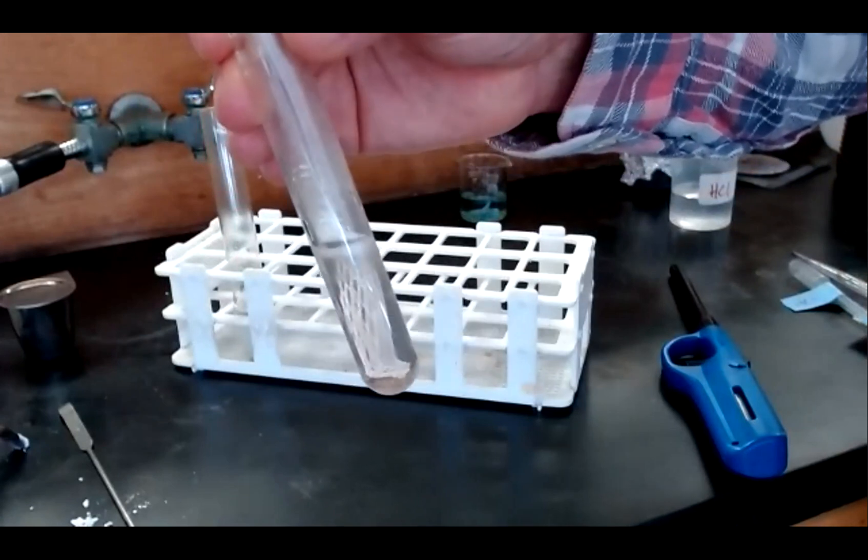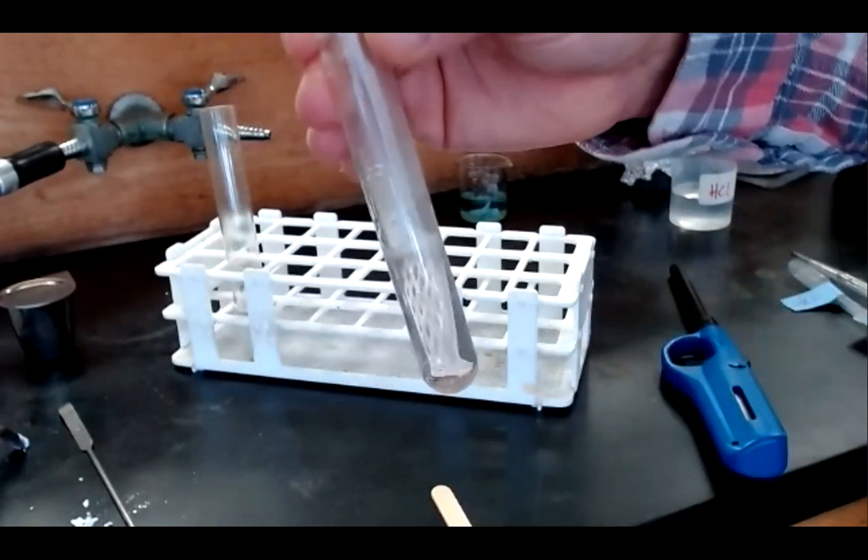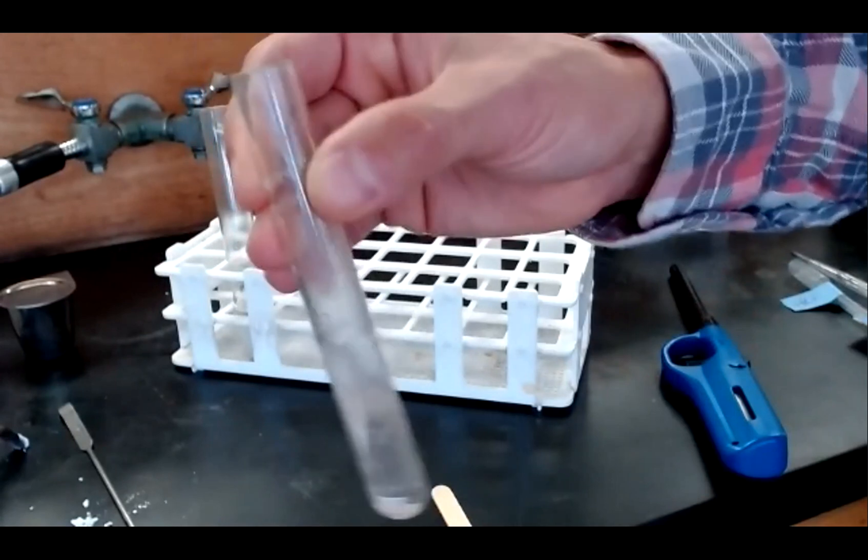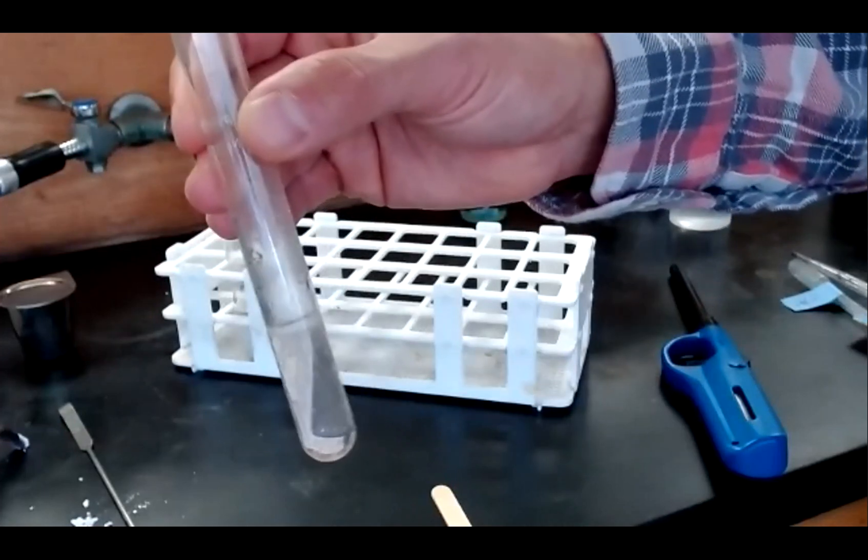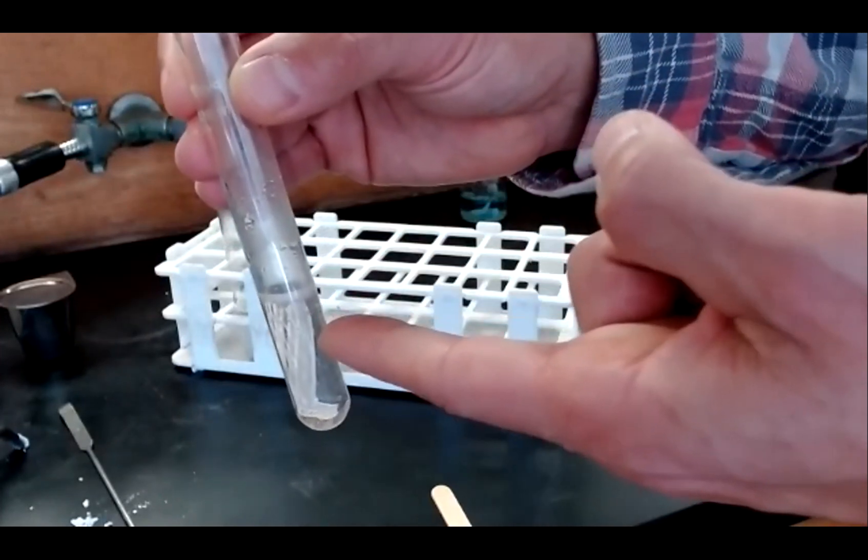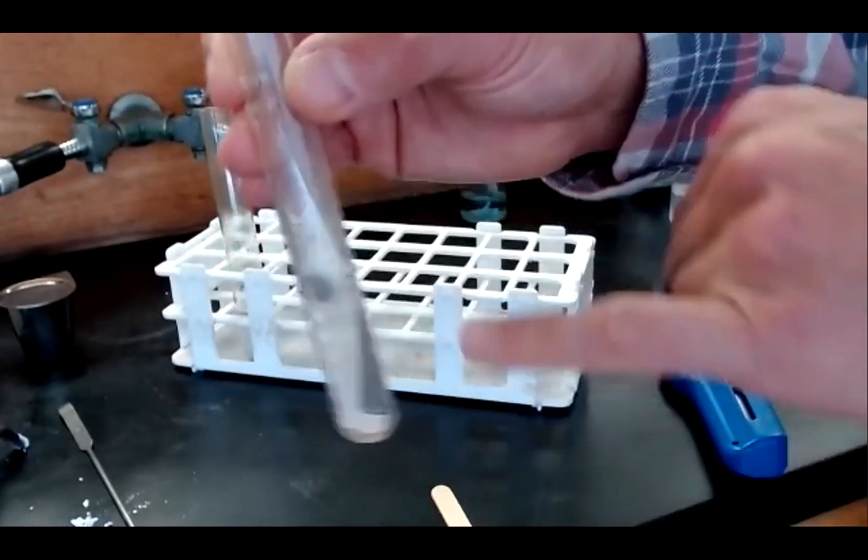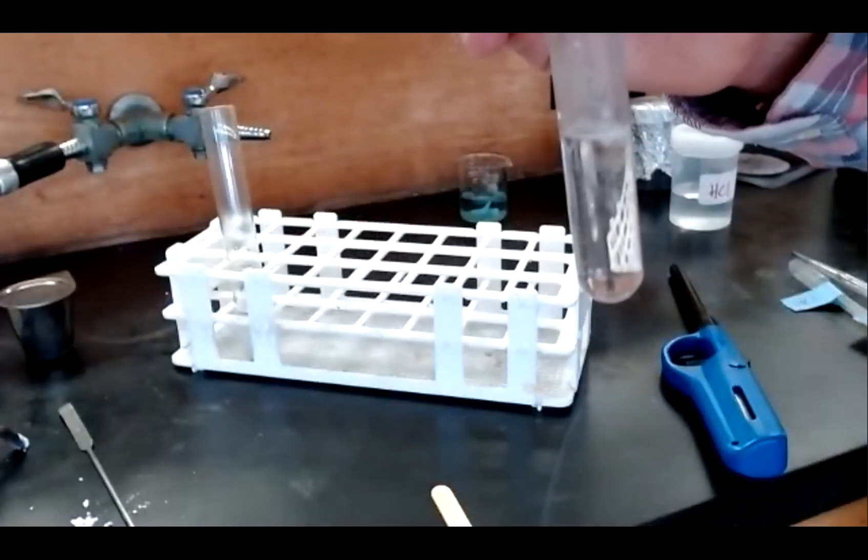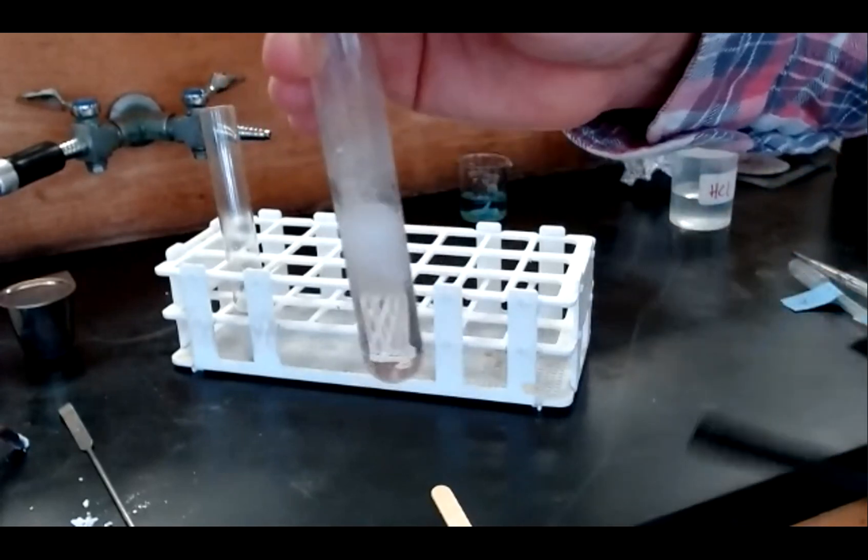Allow this to proceed again. In the combustion reaction, I generated some water vapor. And that's going to hinder the ability of the hydrogen to combust again. So what I'm going to do is wait for that water vapor to either join the water here or get displaced at the top and generate new hydrogen gas. You can see the reaction is still proceeding. But I'm going to add a little bit more magnesium metal to make sure it proceeds fully. And we'll run that hydrogen bark one more time.